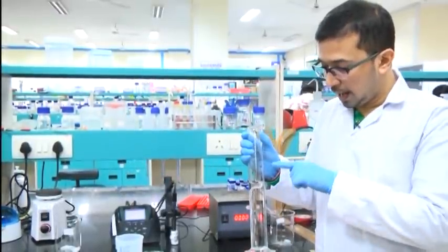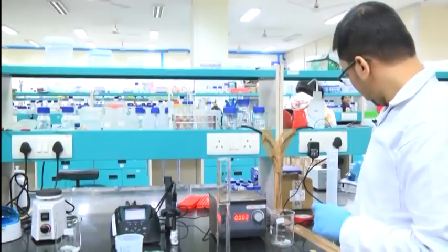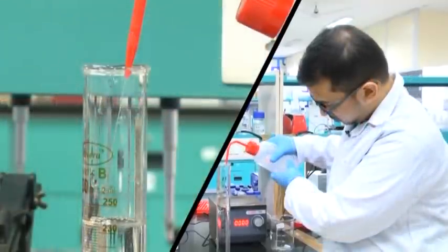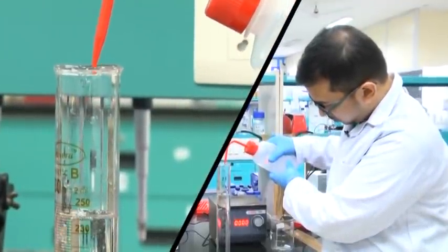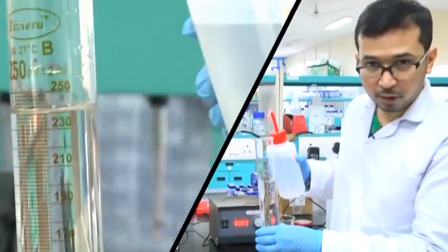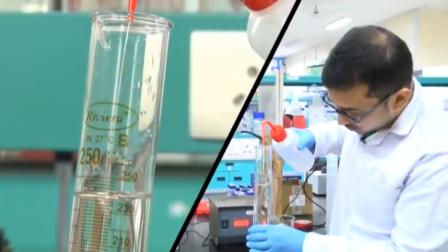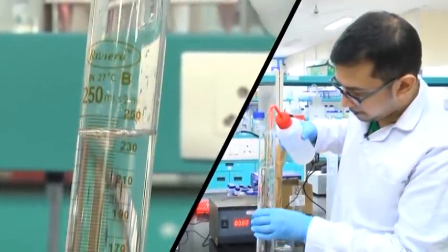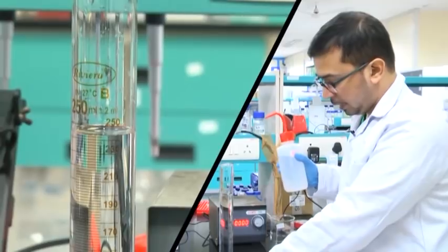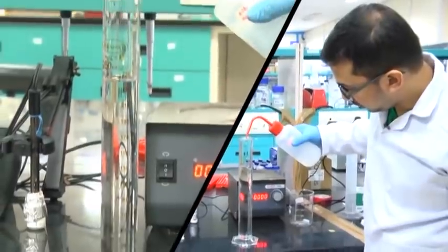Now we will adjust it to 250 ml by taking double distilled water and adding it here. Once it reaches around 230 or 240 ml, pour the double distilled water gradually. While it reaches 250 ml, keep the cylinder in a steady flat place. Do not take it in hand — place it on a flat surface and add double distilled water.